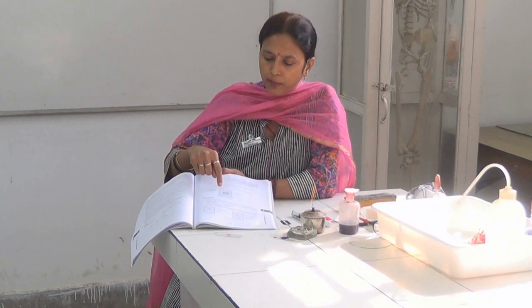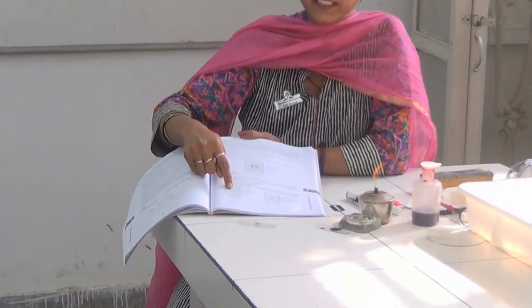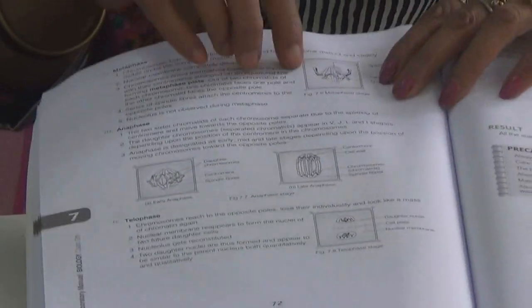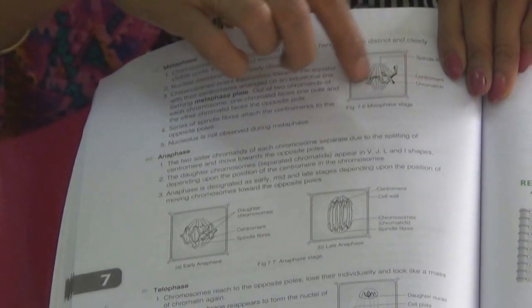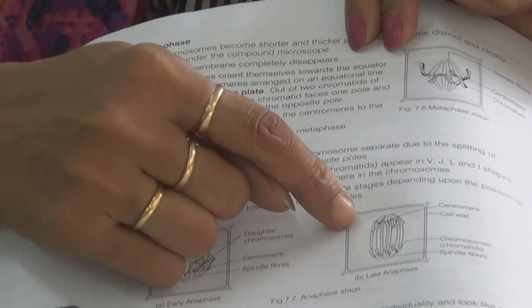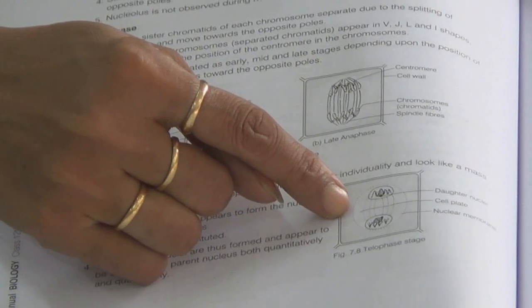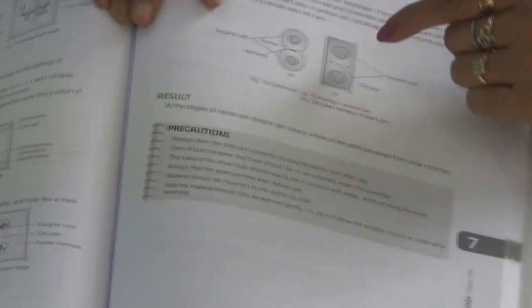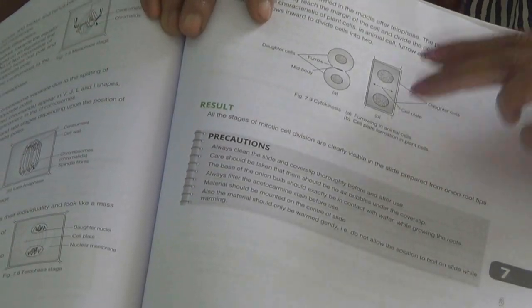Here you can see a normal cell in prophase, where the thickening of chromosomes occurs and the chromosome threads will appear darker. At metaphase, you will see that the chromosomes have moved towards the centre of the cell at the equatorial plate. The next stage is anaphase, where you can see the chromosomes being pulled away towards the two poles. In the last stage, telophase, you can see that there are two separate nuclei covered with a nuclear membrane, meaning the last stage of mitosis is over and two daughter cells have been formed.